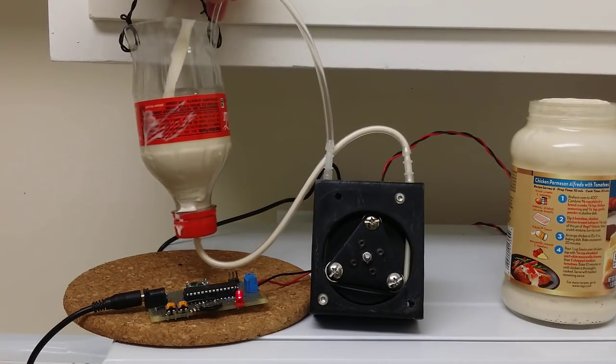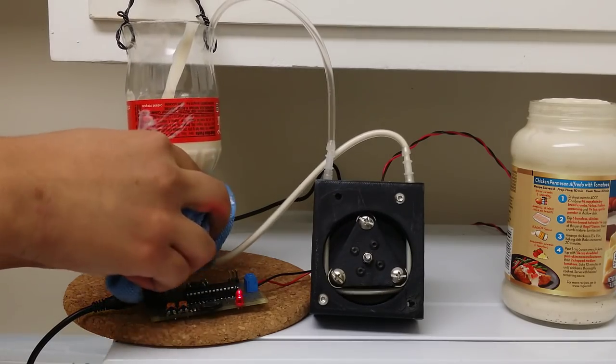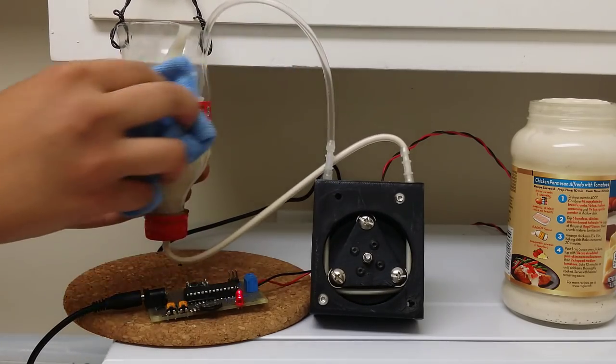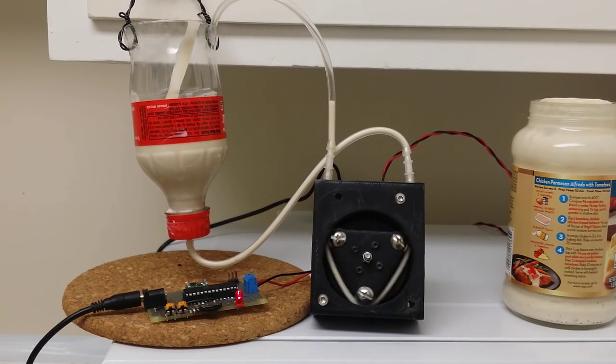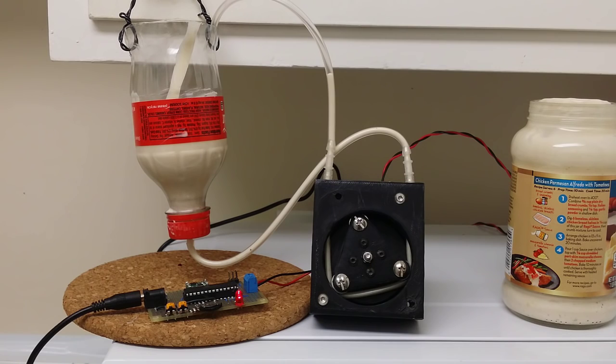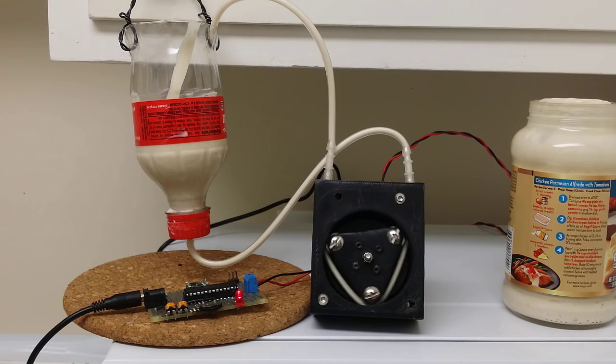And see it come out of this tube. There it goes. And it should flow right back into the bottle. I'm just gonna let it sit for a few hours, even overnight, just to see how durable this thing is.